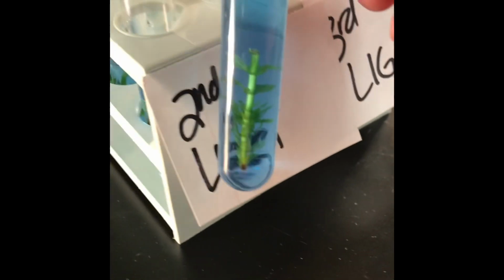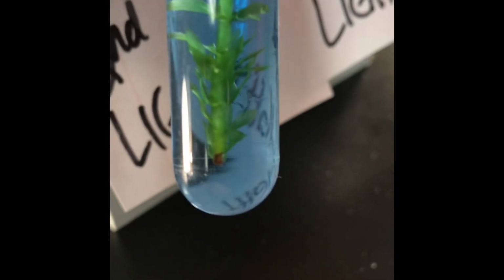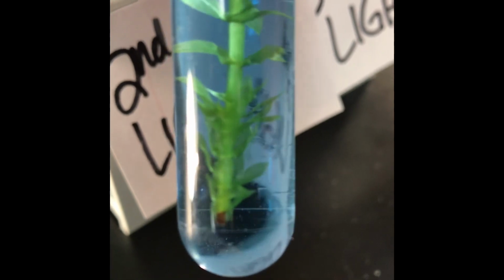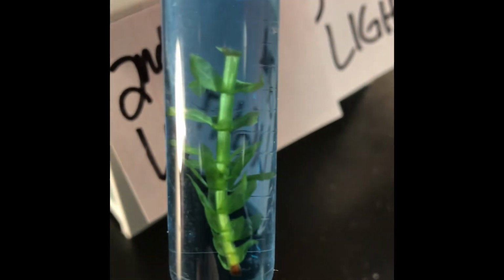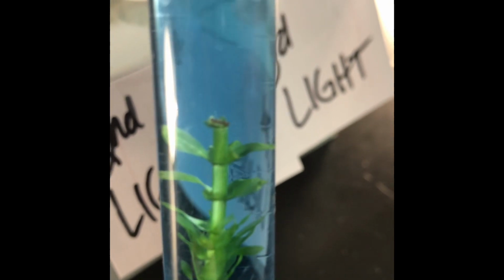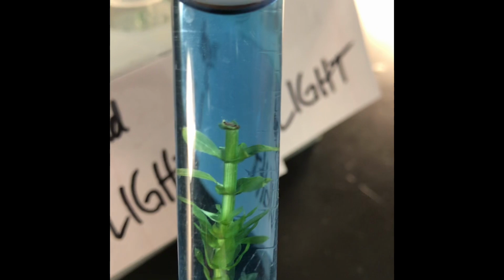Look at this beauty. Look at that. Can you not see how amazing? Look at that color. I'm gonna even bring it closer so you can see. Look at those little bubbles. They're little tiny bubbles if you look closely on the leaves. Little bit of photosynthesis going on, right? Isn't that beautiful? Okay, so look at that color, because you need to think back to what did this tube look like before we put it in the light.